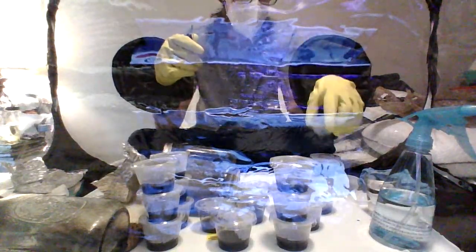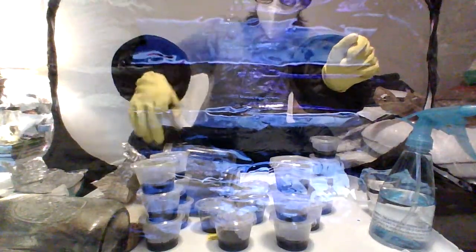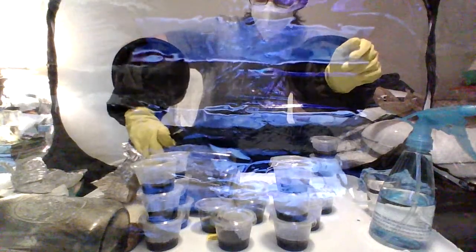I have my stack of bacterial contaminated dishes here, right? All right, let's see here. I think it may be easiest to demonstrate using one of these. I'm going to use the one that I poured into, not the one that was the container for the agar. Still using that too, but all right.